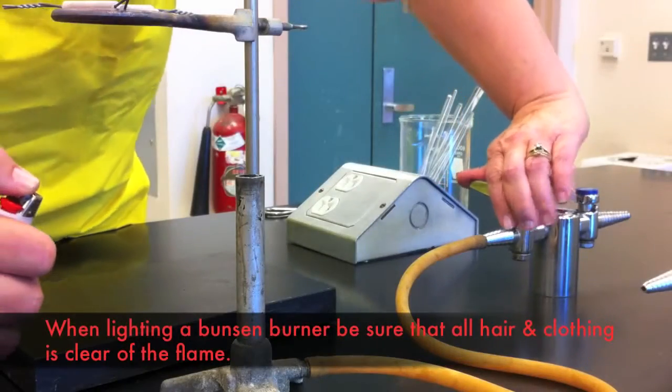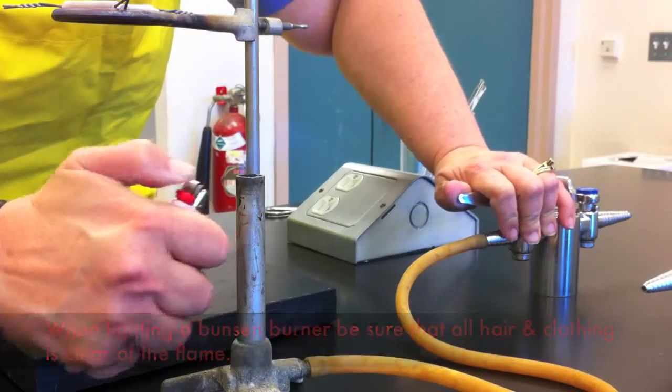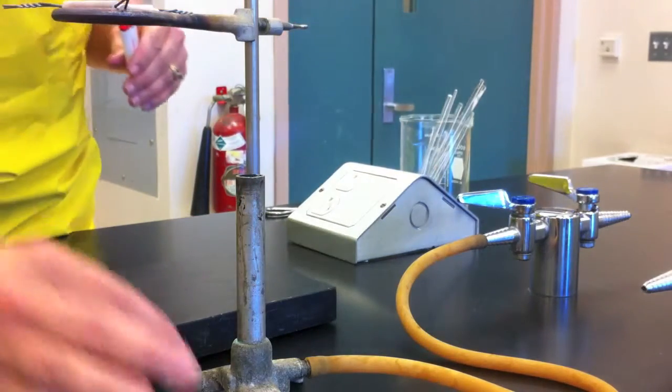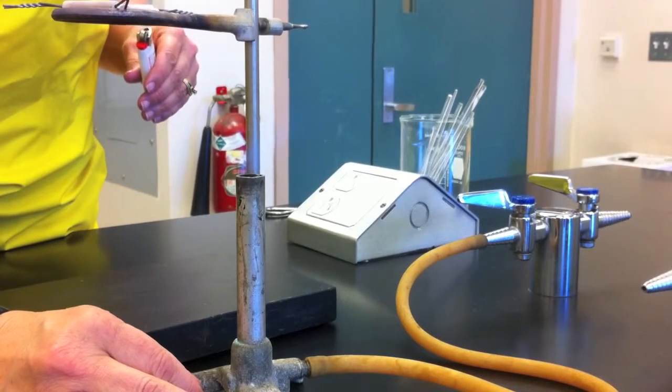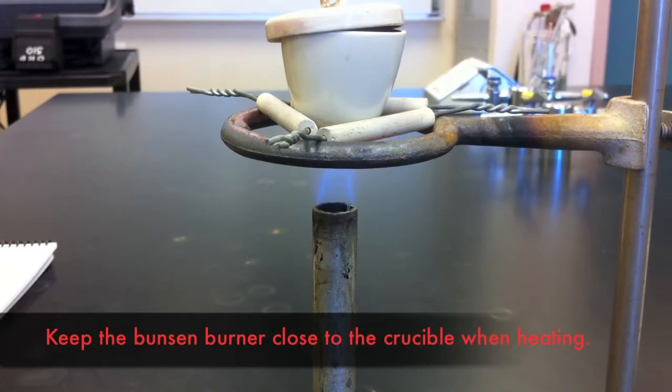When lighting a Bunsen burner, ensure that anything flammable such as hair or clothing is well out of the way. Turn on the gas flow and then bring a light, match, or lighter towards the end of the Bunsen burner and it should ignite. In order for this reaction to proceed properly, you need to make sure that the Bunsen burner is close enough to the crucible to heat it well.